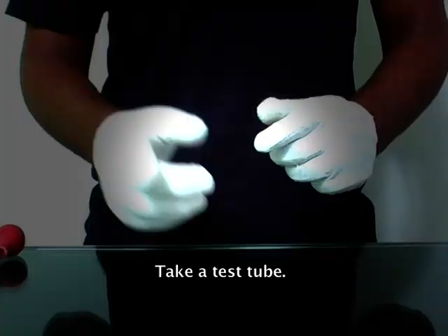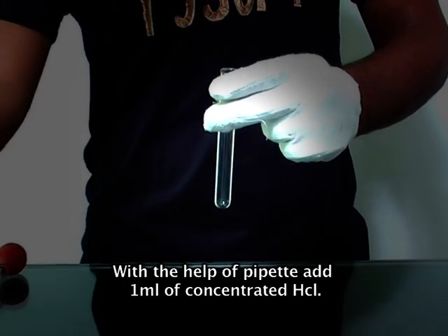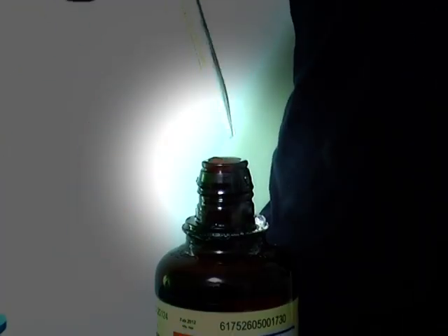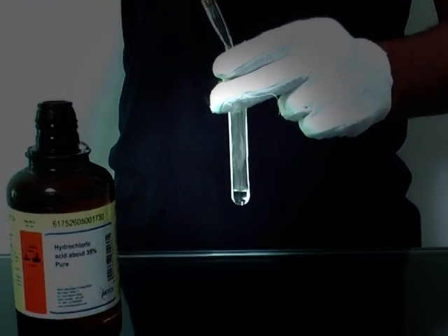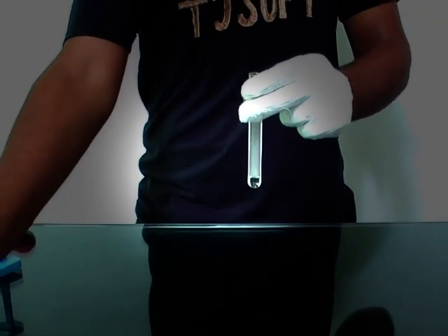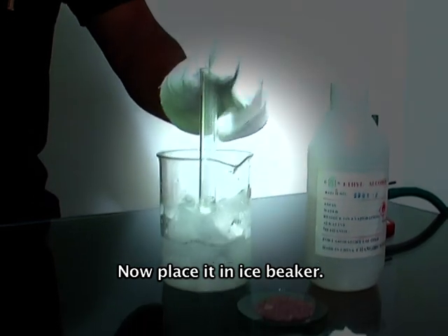To confirm it again, we have another experiment — that is the azo dye test. Take a test tube. With the help of a pipette, add 1 ml of concentrated HCl. Now place it in an ice beaker.